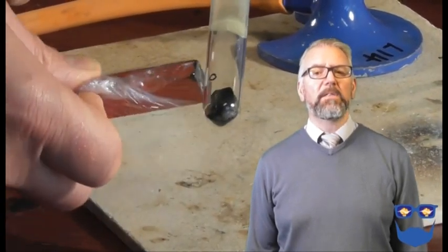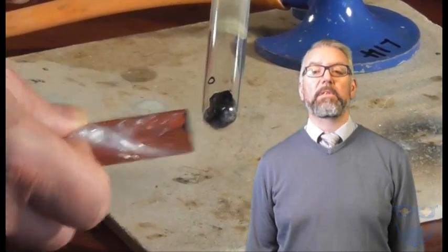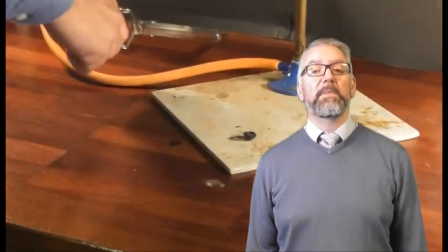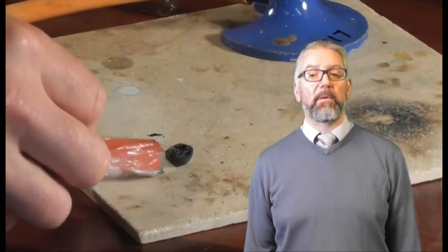As you can see the iron sulfide moved with the magnet. This would be a perfect opportunity to introduce the idea of percentage yield and some of the reasons why we don't get 100% yield in chemical reactions.